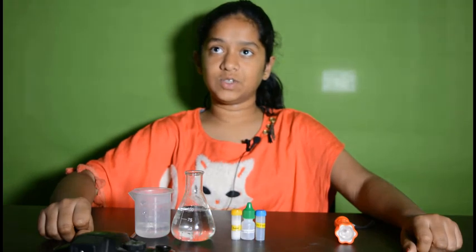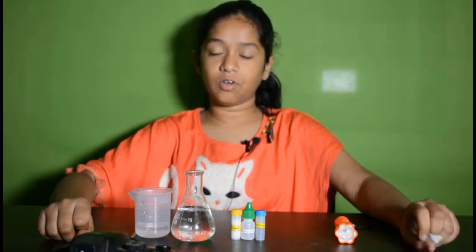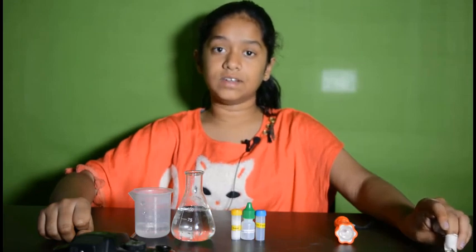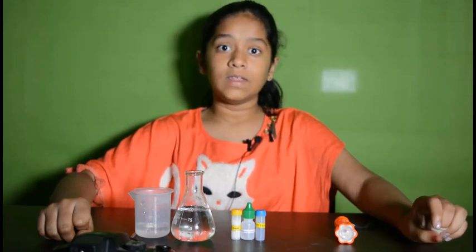Hi friends, I am Dhanushree H. Today I will demonstrate an experiment of reduction reaction where potassium permanganate is reduced by sugar in alkali medium.